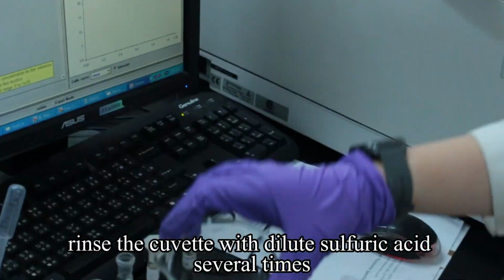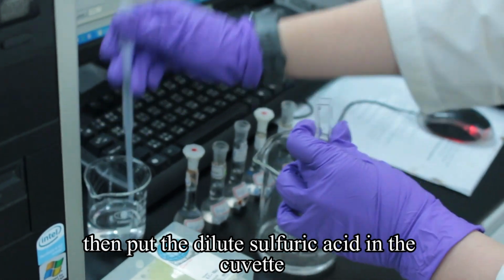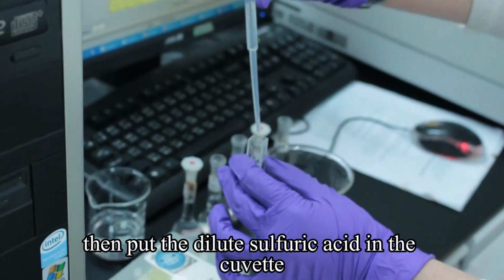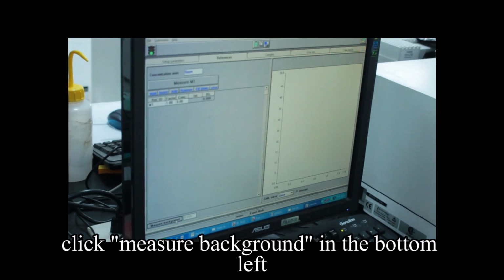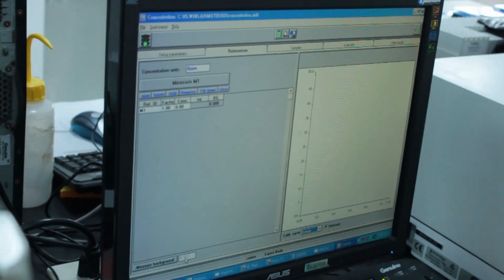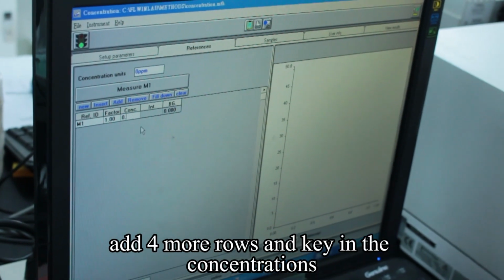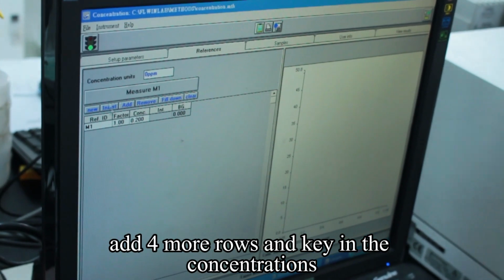Rinse the cuvette with dilute sulfuric acid several times, then put the dilute sulfuric acid in the cuvette. Click Measure Background in the bottom left corner to start. After the button turns green, add 4 more rows and key in the concentrations.